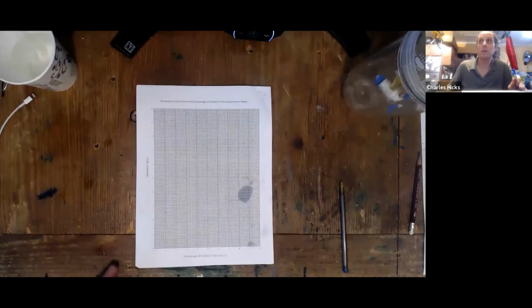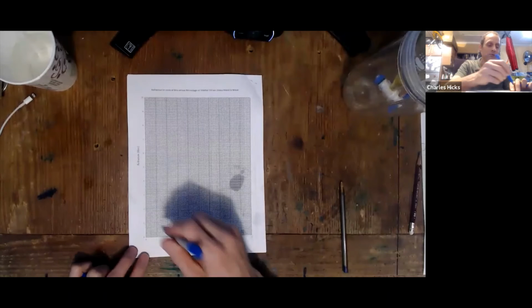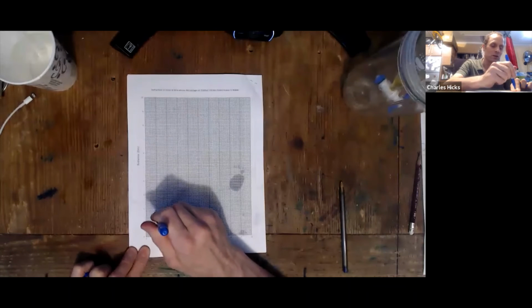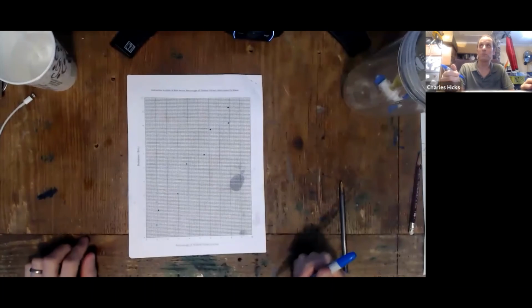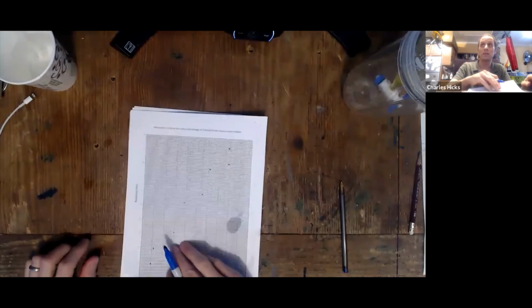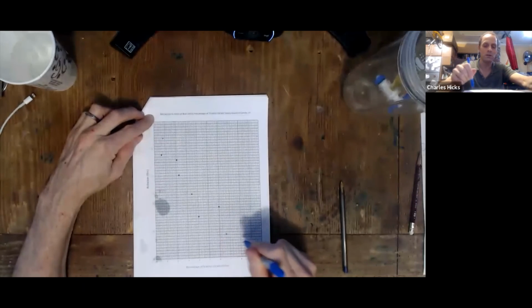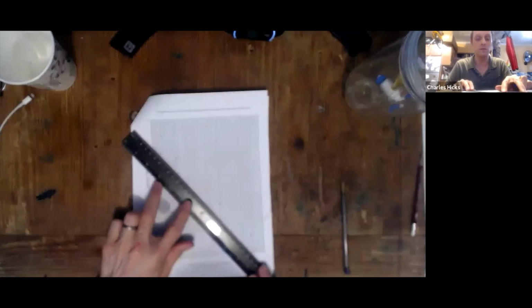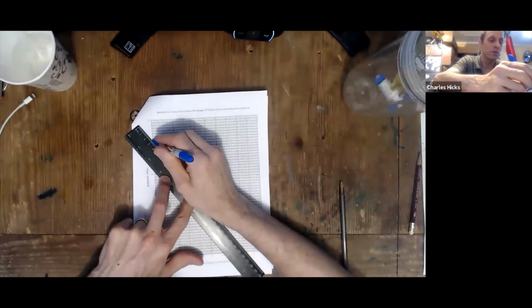When all that data has been collected, you're going to prepare 2 graphs. Those graphs I'm going to just make rough sketches of. The graph paper has been prepared in the lab report, and you probably will see both of them varying with a certain amount of % error. One of them may be increasing, and the other one, very likely you may see to be decreasing. Both of them you should draw some interpretation of. You could draw a linear interpretation, or if you think it looks curved, the smoothest curve you can easily draw.